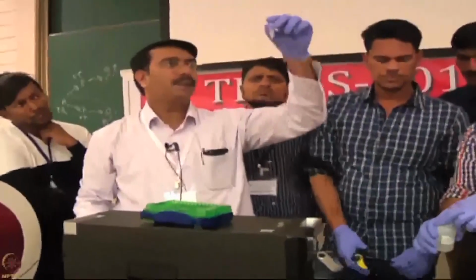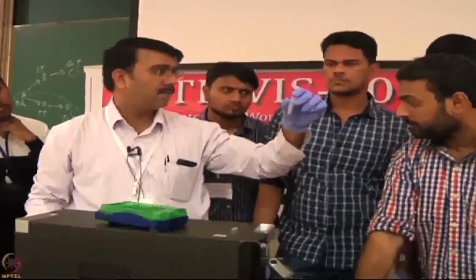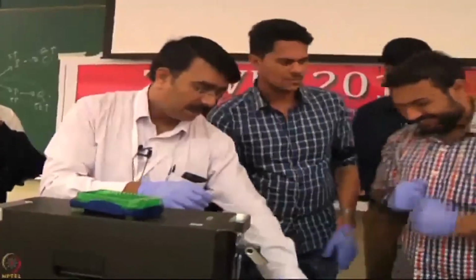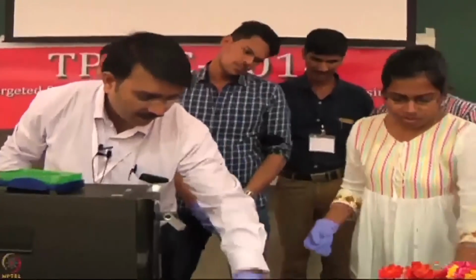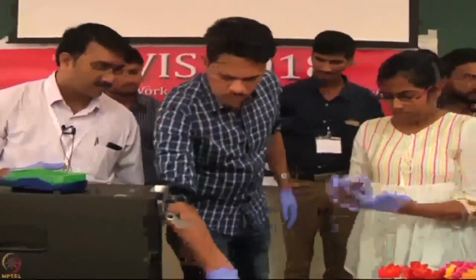Okay, now I have protein A here, the biotinylated protein A, at 250 microgram per ml. Take around 15 microliter from this, then make up to 1500 microliter. We should let others do it. Take around 15 microliter diluted to 1.5 ml.